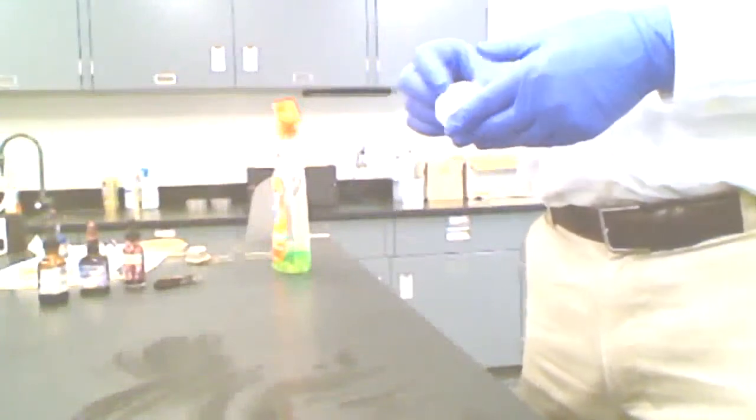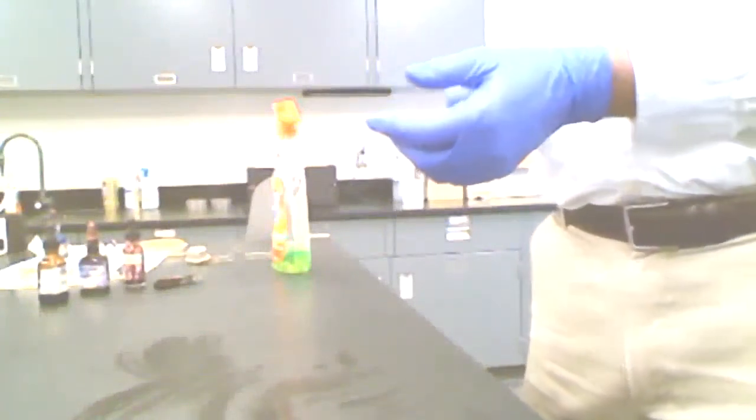And then the next thing we're going to talk about is the fact that for that purpose we're using a basic dye, okay? We'll have to set the camera back up for this, but we'll have Professor Jeter go into an explanation about why we call this a basic dye. So what's up with that? If I ask you, what have I done? You could say, well, you simple stained. And this particular version of simple staining is a positive stain, and it utilizes a basic dye.